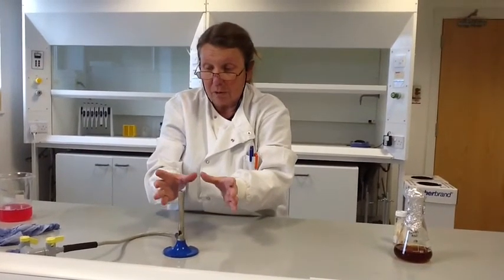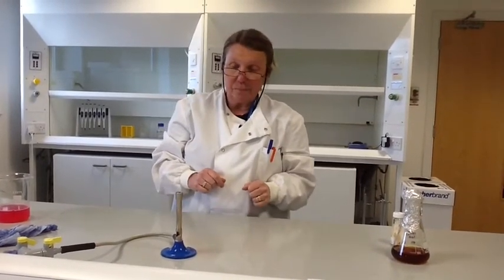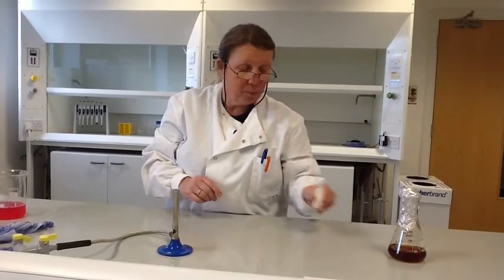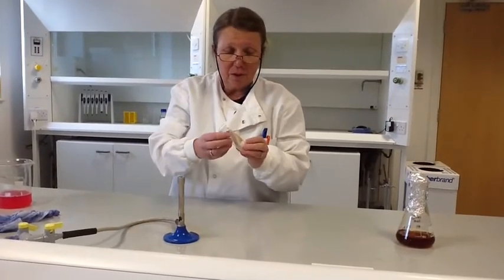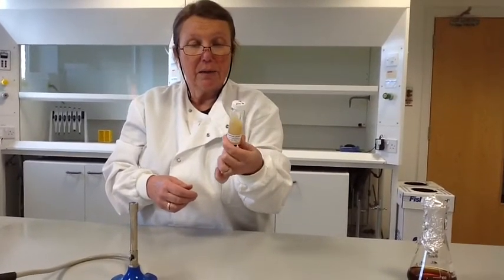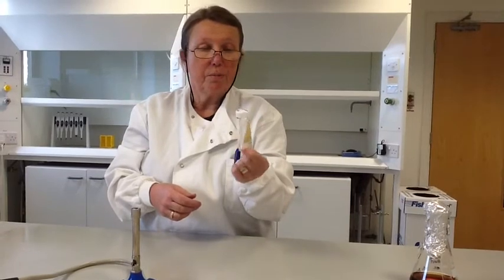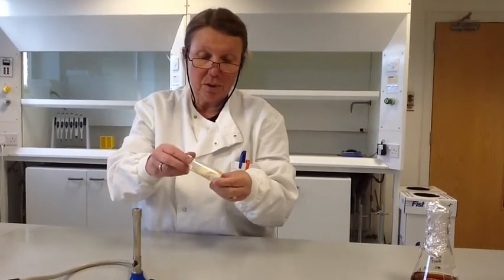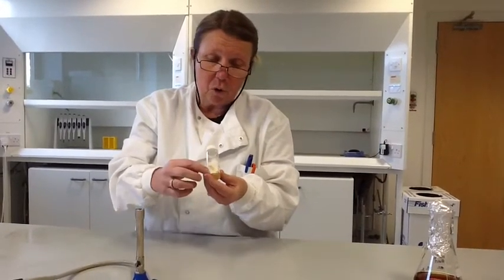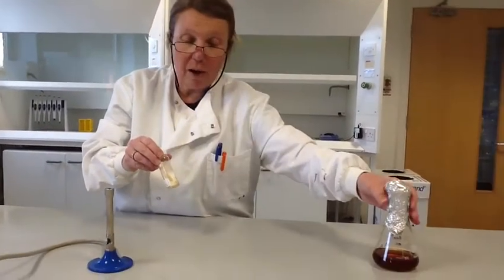Students can prepare their own little sterile area on the bench to work in. What we're going to do today is set up an experiment to grow a Fusarium solani culture. This is a culture obtained as a slope from Blade Biological in Kent, and it's very closely related to the organism used to produce Quorn. Quorn is a mycoprotein, meaning it's derived from a fungus. You can see on the slope here that we've got nice white fungal growth, and we need to use that to inoculate into our liquid culture.